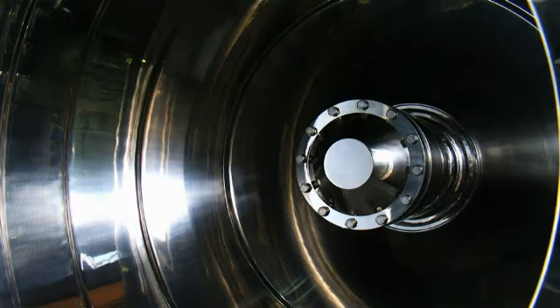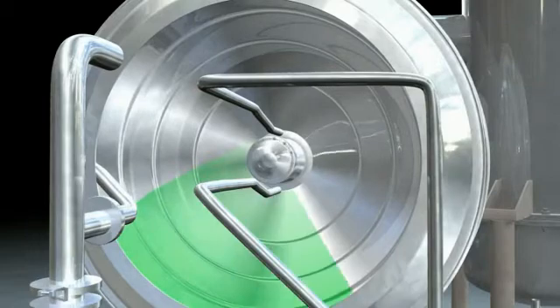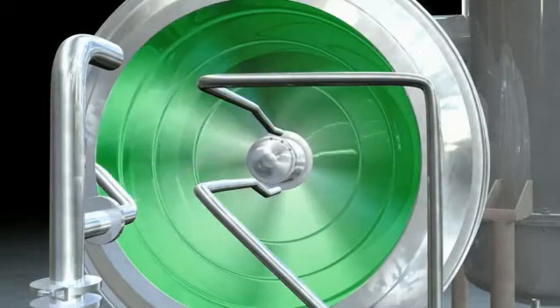The inside of the Evapor is equipped with a high speed jacketed rotor. Liquid is supplied to the center of the rotor via a feed pipe. The centrifugal force generated by the spinning rotor acts to thin the liquid into a film just 0.1 millimeters thick, spreading it across the heating surface. The liquid's retention time on the evaporation surface is less than one second.